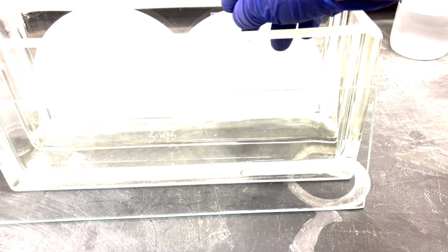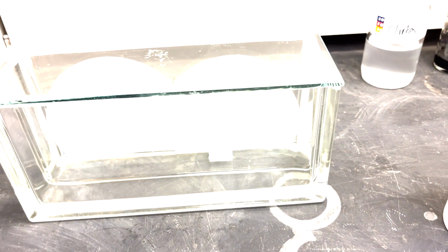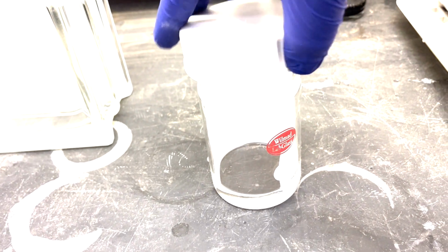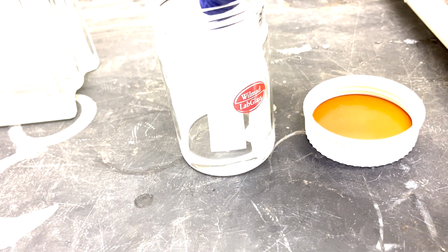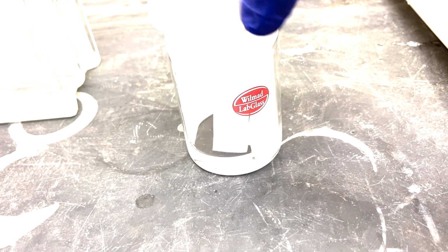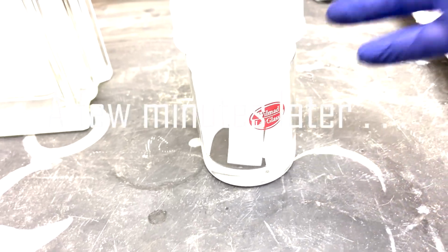When you place the TLC plate in the chamber, leaning against the wall, if the origin is in the solvent, this is heartbreaking, but you have to get rid of it. If you put it in and the origin is in the solvent, you really want to pull the plate out, get rid of it and start again, because that'll wash your stuff away and you won't get anything. So be careful putting it in, and make sure that you put your origin high enough that the origin isn't down in the solvent. The solvent needs to wick up to the origin and then pass that.